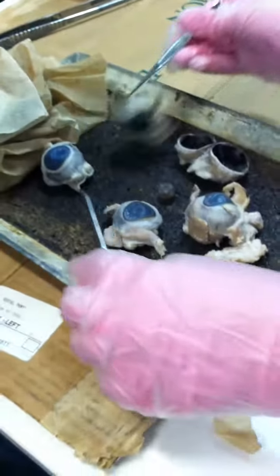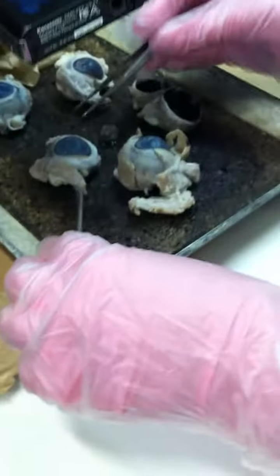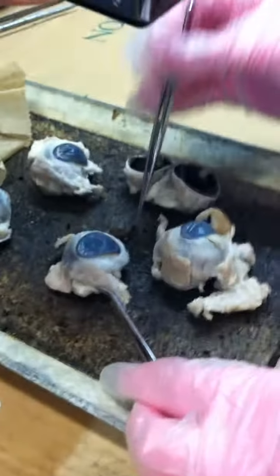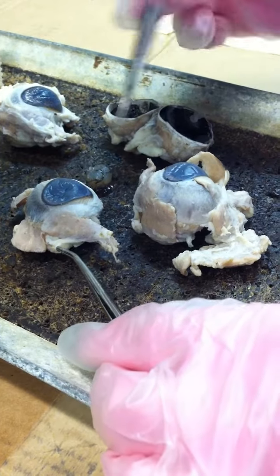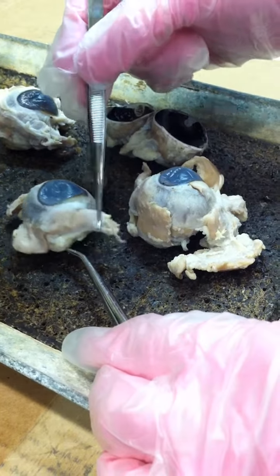Get a good eye. I'm going to get a bunch, and I'll have you guys identify them. All right, so for the eye, you have to look for the shape of the eye, and also for the most important muscle on the eye to orient it, whether it's left or right, which is the inferior oblique. The inferior oblique always goes from the lateral side and runs medially, so it's this muscle right here.